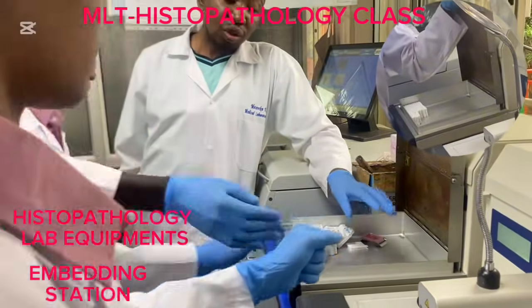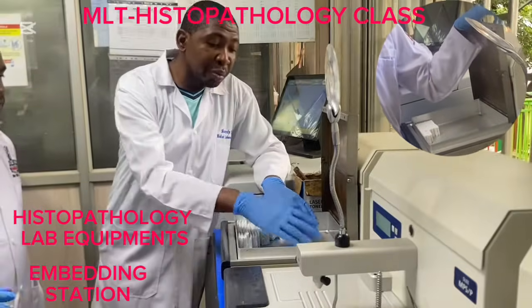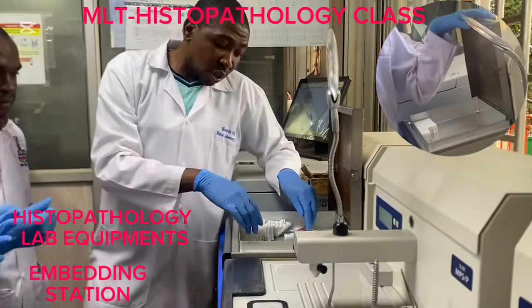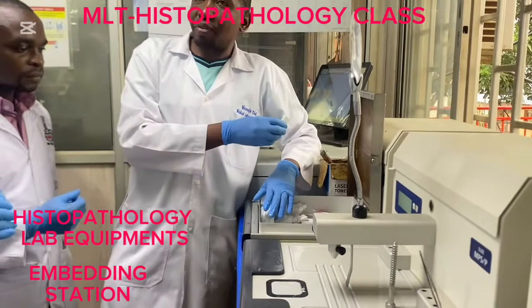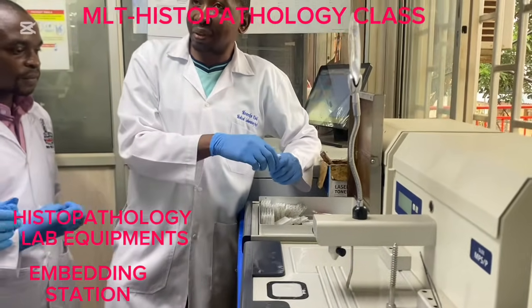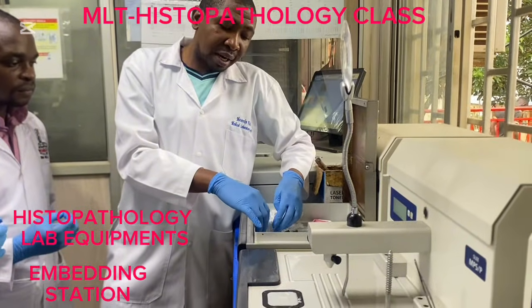Okay, so you realize that it is also warm. When you remove your hands, paraffin wax solidifies immediately. Since these samples are coming from the processor, we said the last agent was paraffin wax. Okay, so we still put it in this chamber which is warm.